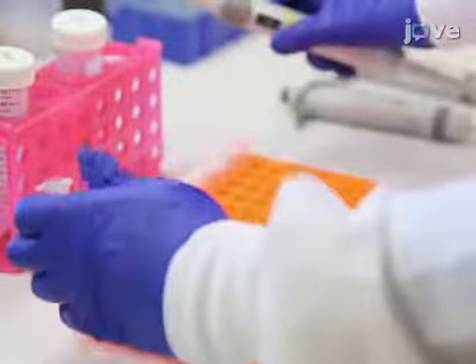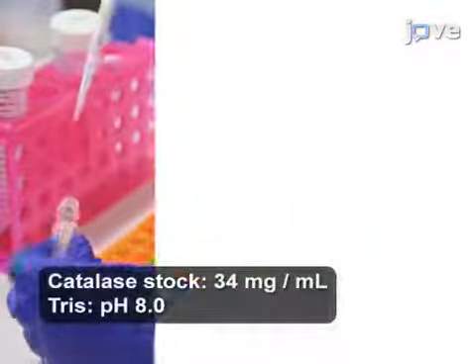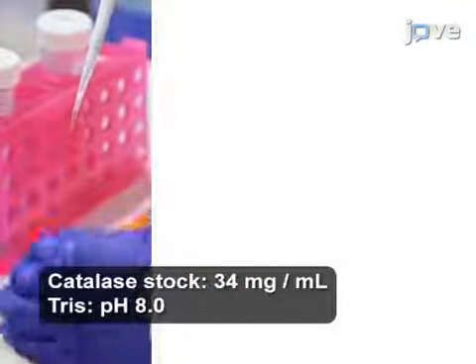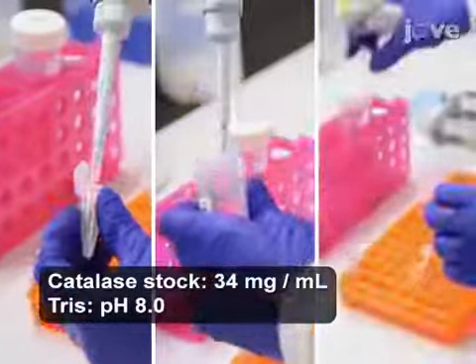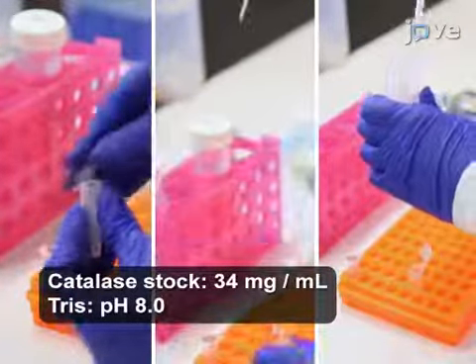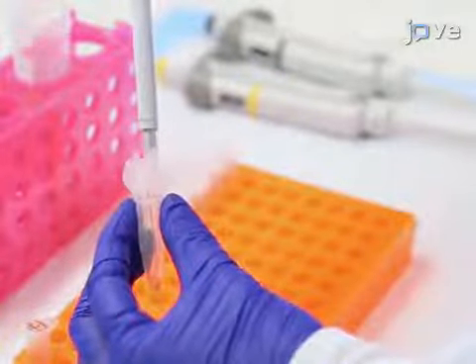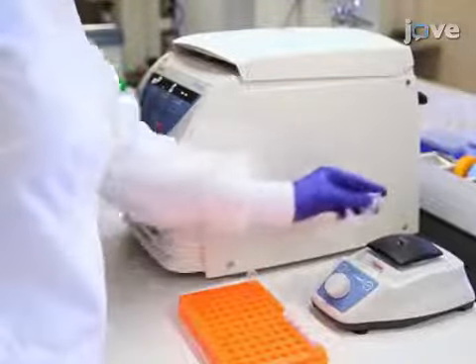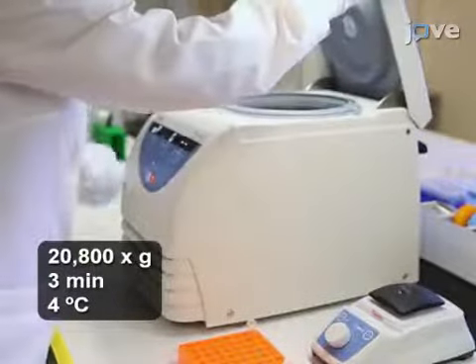Next, prepare the oxygen-scavenging Glox solution by first adding 12.5 microliters of a catalase stock solution, 3.5 milligrams of glucose oxidase, and 0.5 microliters of 1 molar Tris to 49.5 microliters of PBS in a 1.5 milliliter microcentrifuge tube. Close the tube and briefly vortex it to dissolve the components. Then centrifuge the solution for 3 minutes.